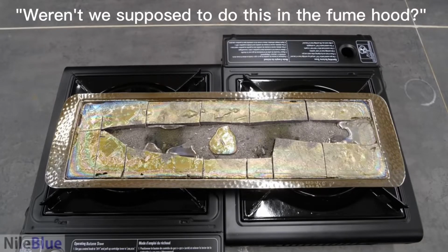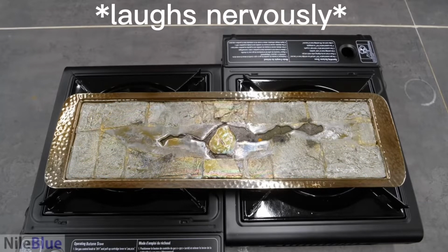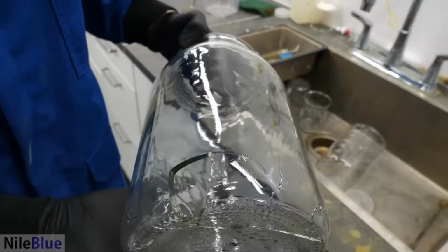Yeah, weren't we supposed to do this in the fume hood? It's kind of an oversight. It's not that bad.